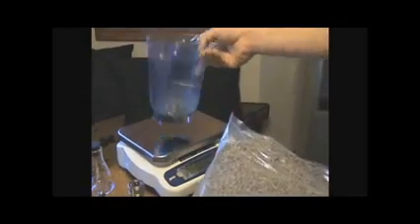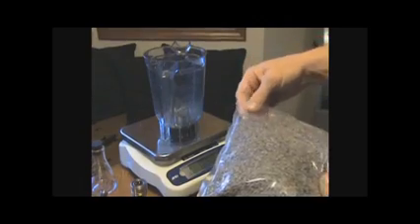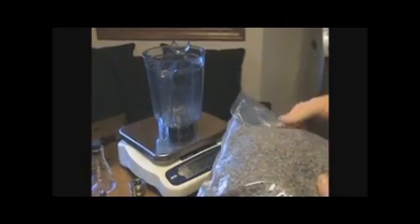We're going to extract some lavender — this is a bag of our whole lavender flowers. I'm going to fill this up with two and a half ounces, so I need to grind it up in this dry container from a Vitamix. I usually grind it at about speed eight for maybe a minute or less.